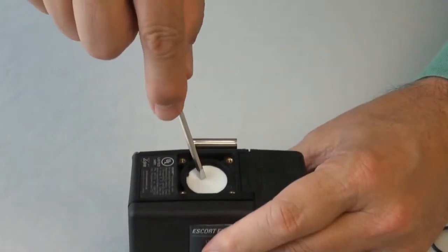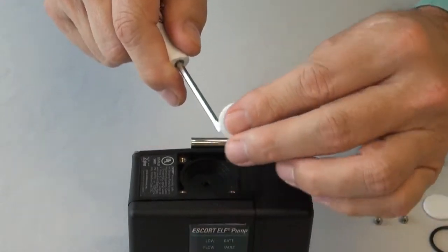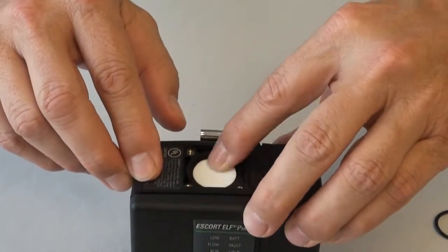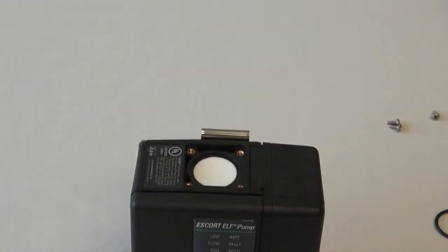To remove the filter frit, stab the center of the frit with a small screwdriver and lift out. To reassemble, place the rough side of the frit down and press into position. The filter frit should never need to be replaced if the other filters are properly maintained.